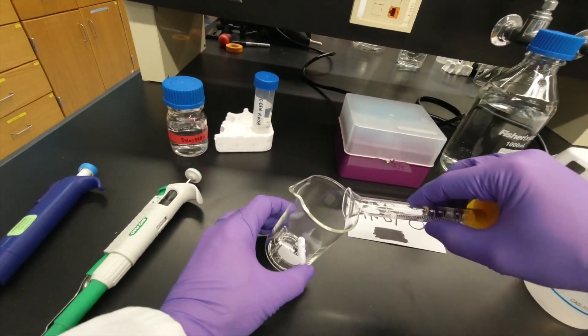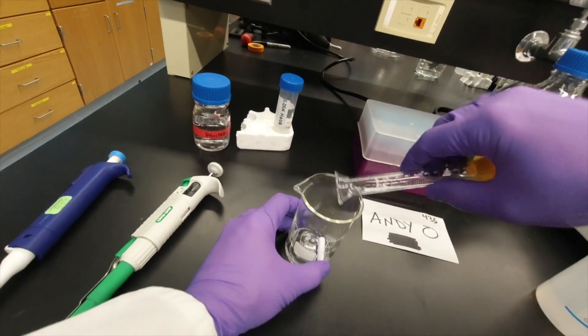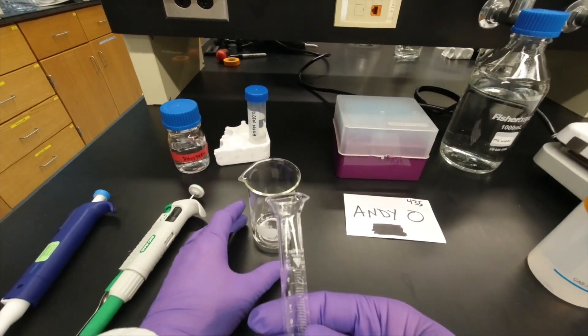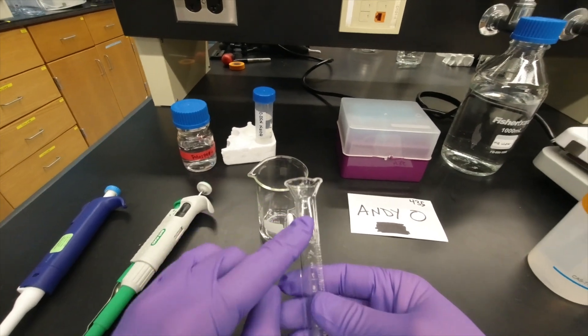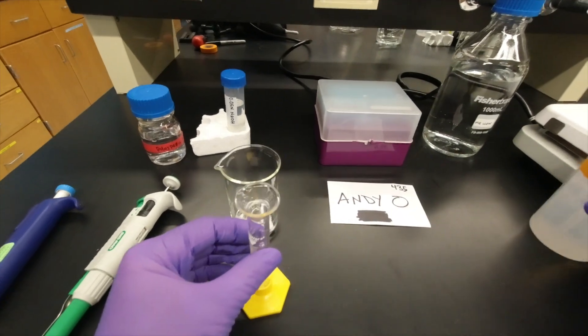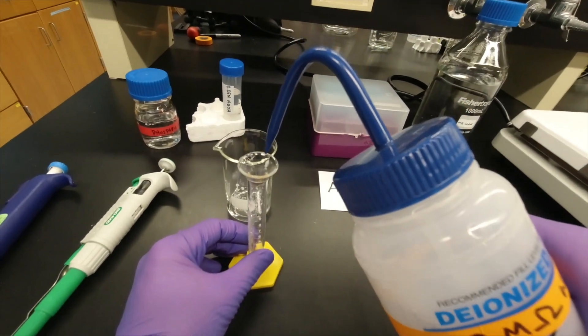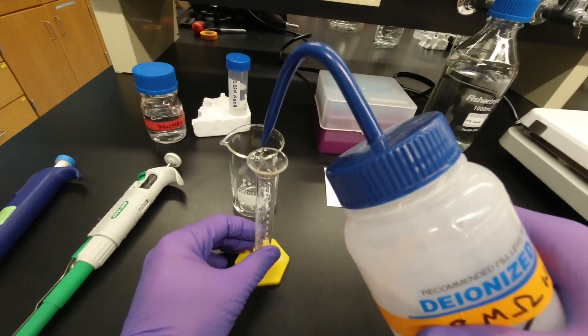And then you need about 50 milliliters. Now what we see is that there's liquid here on there and all inside. So one thing you want to do is take your 18 mega-ohm water and gently squirt it.